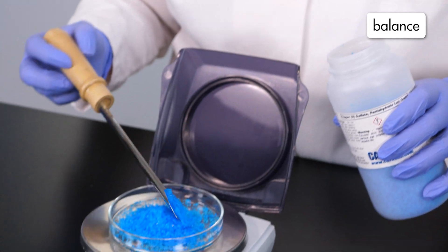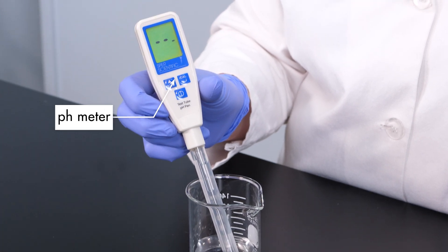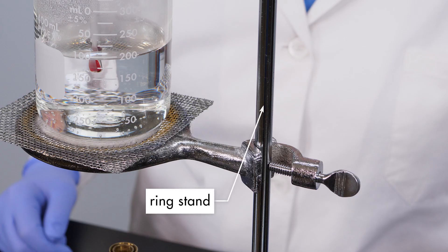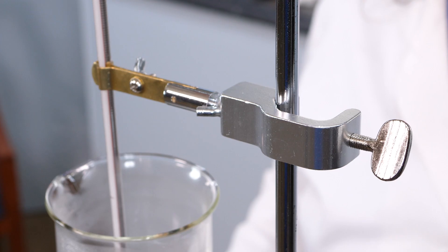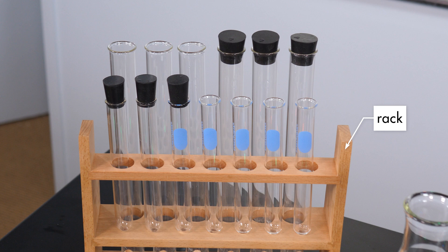Hardware includes a balance for finding the mass of a substance, meters such as pH meters and digital thermometers, burners, ring stands, rings, clamps, tongs, and racks for holding glassware. Scientific instruments and the people who use them are imperfect, so errors in measurement can occur. To help minimize errors, scientists must take extra care with measurements and often take multiple measurements to ensure both precision and accuracy.